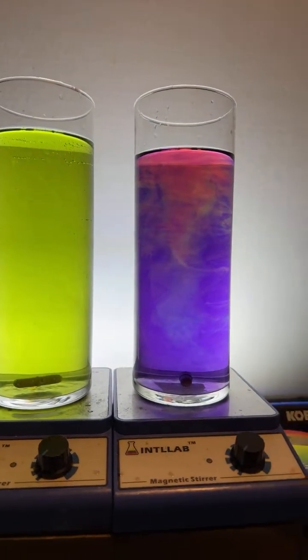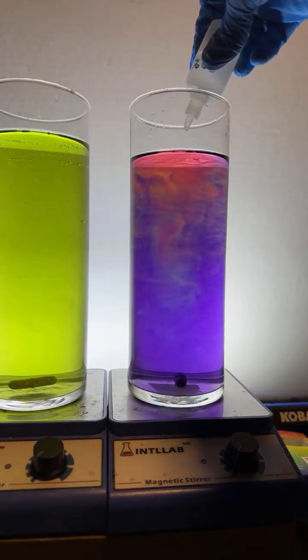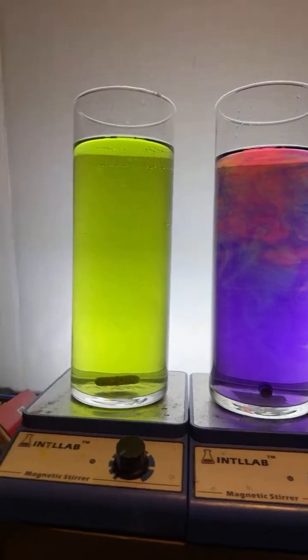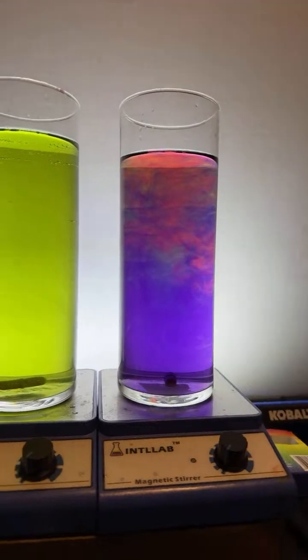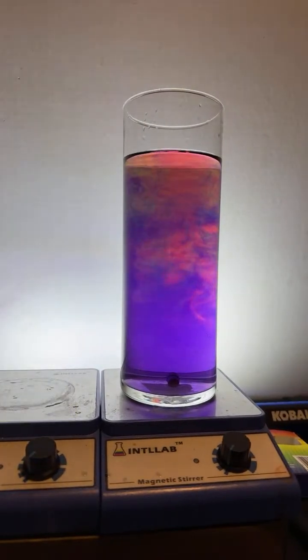We're getting a little bit of beauty over here, and that's kind of cool. Let me add a little bit of acid over here to try to make this a little lighter. And I'm going to get this off of here because the buffered system is really kind of boring. I mean, once you see it once, it's like, okay, we got the color. Nothing's changing over there in the buffered system.